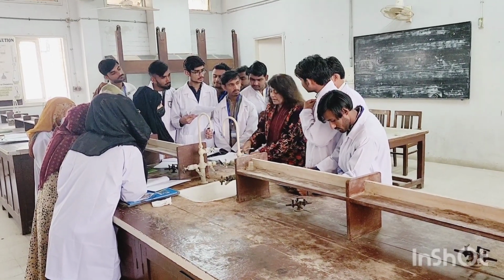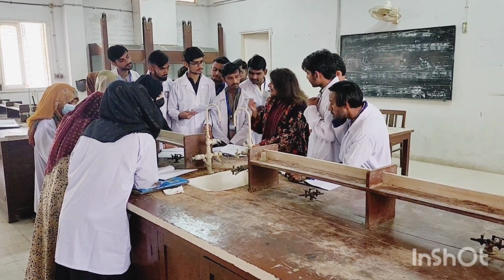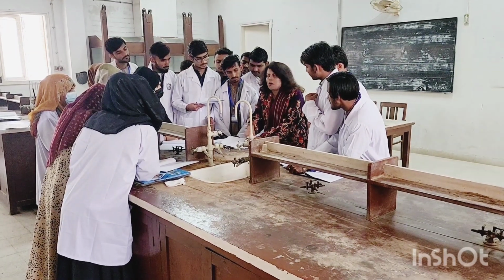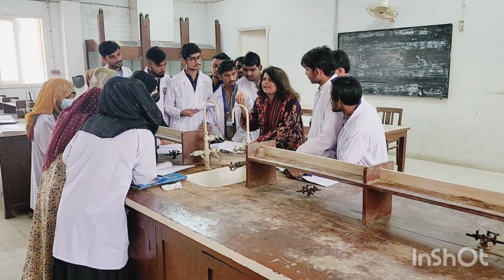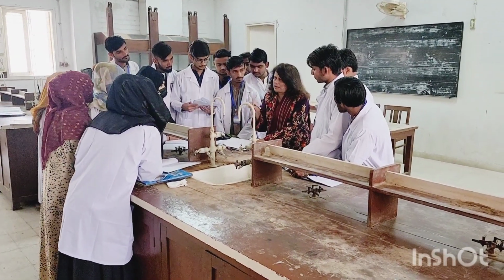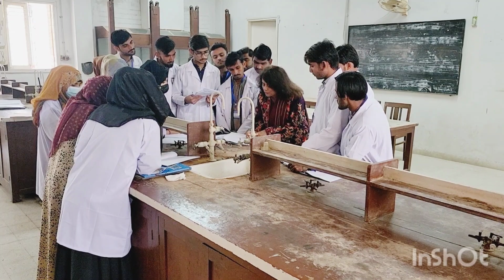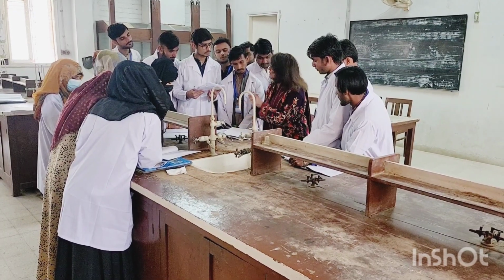Solution of the compound means that now you know in which solvent your organic compound gets dissolved. You will select that solvent, fill it in your test tube, and add the compound, and it will get dissolved, because you have already done the solubility test. So this is called the solution of the compound. Plus 5 drops of potassium permanganate. These are the options, and then you progress further.